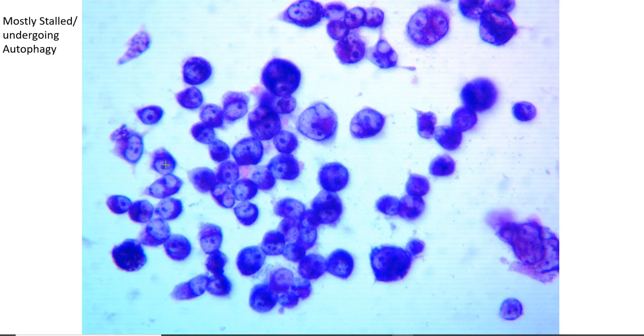Okay, so here's another culture. This particular one has been treated with Taxol at some low concentration, so we can still see cells that are there. They're not all dead or dying yet. And now you can see cells are looking different. In this case, you see again that you have your cell membrane outside. And in many of these cases, you're going to have stalled cells. And you see that in here by having the nuclei right inside.